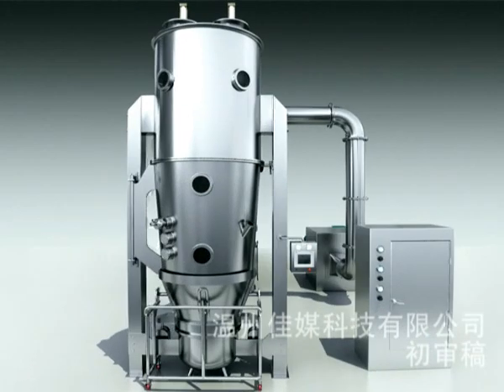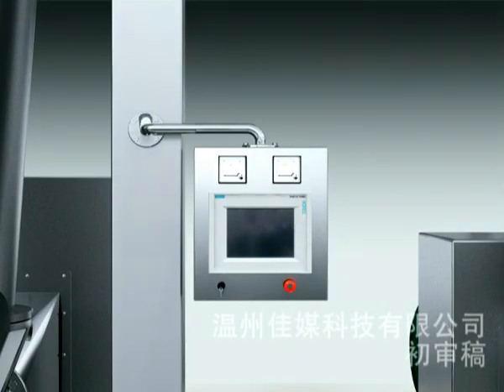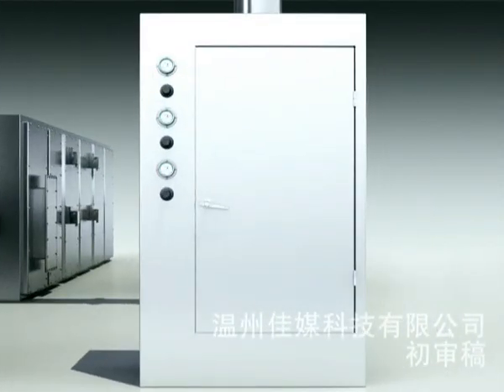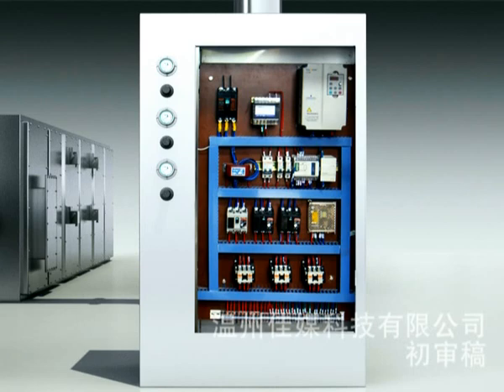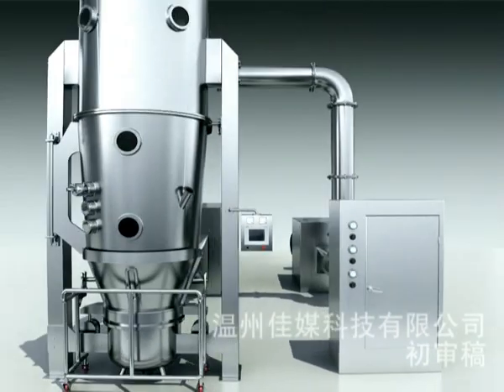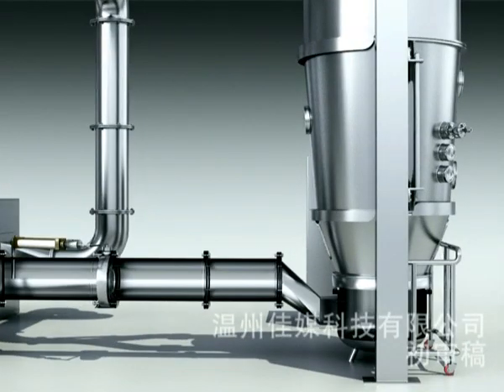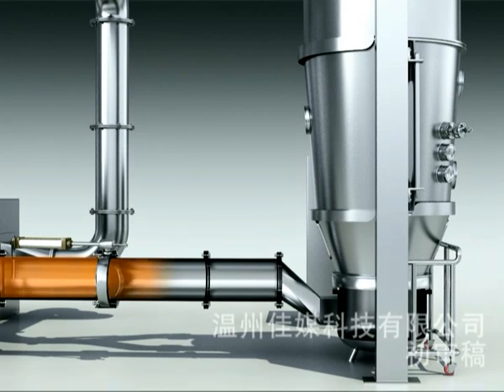Control system. 1. Siemens PLC and human machine interface are normally supplied for the control system. 2. An inverter is normally used for the suction fan, so as to adjust the air velocity and pressure smoothly and save energy. 3. Air speed and humidity transmitters are normally used for this system, so as to measure the inlet air speed, which might be converted to air velocity, and the humidity, or the humidity after the dehumidifier if applicable. Thermostable air speed and humidity transmitters are available on request. They will give the air velocity and humidity just before the air enters into the fluid bed.